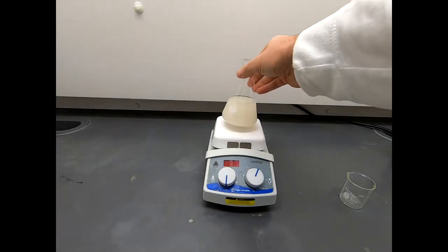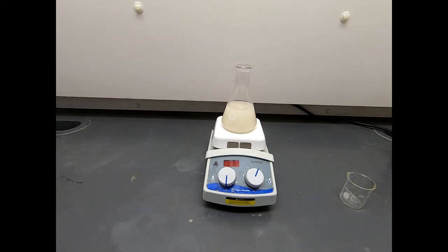This is now all nice and cool. There is no change at all to report. But now we have a problem. We need to get our product out of here. There ought to be a lot of our azide in this reaction and it's all mixed in with different salts and mostly a lot of DMF. DMF is a great organic solvent. However, most organic solvents that you commonly encounter in the lab, they're fairly volatile. So you can evaporate away the solvent and get your product. DMF is really high boiling and so you can't just evaporate it away. So we're going to have to do a liquid-liquid extraction on this. We're going to have to do a traditional workup on this reaction using a separatory funnel to separate our product, our very non-polar product, from the very polar DMF and water solution that our product is right now dissolved in.